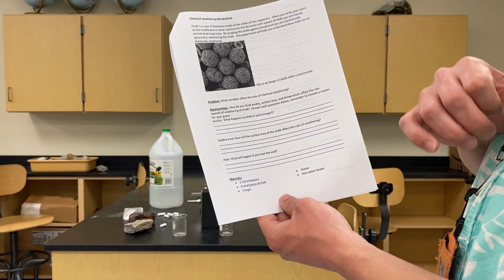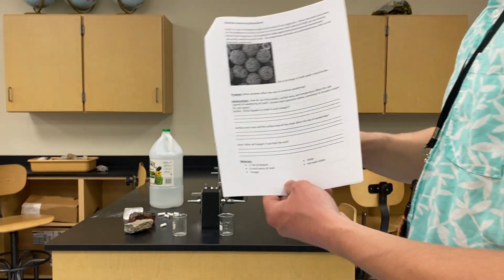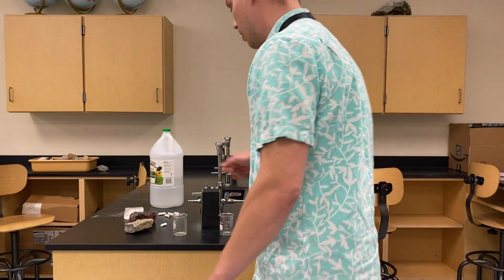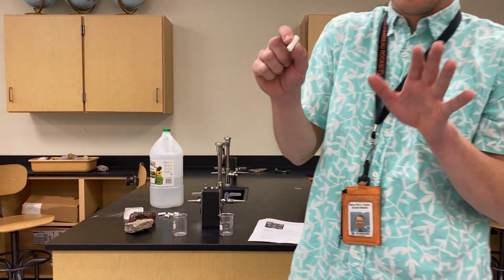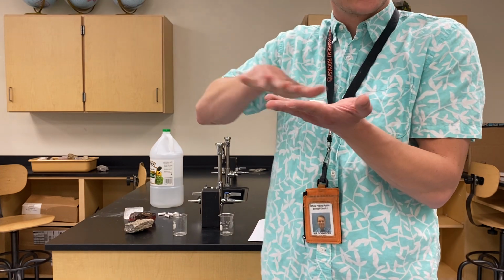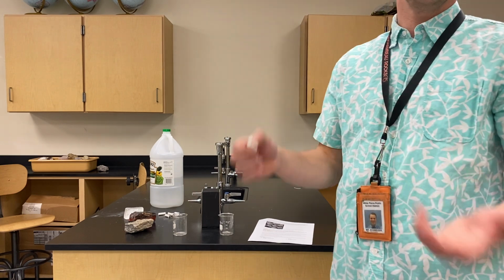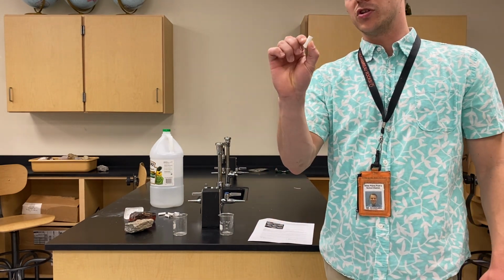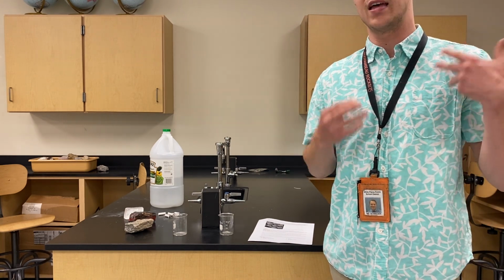Also, make a prediction about how the surface area, or the amount of area that the chalk can cover, may affect the rate of weathering. So if I were to turn this chalk into a different form to make it spreadable, I would just crush it into pieces so I could spread it out over a larger surface. So that question is really asking you, what do you think is going to make the chalk weather more? If it is just one solid piece, or if we break those pieces into a large surface and then weather that large surface.